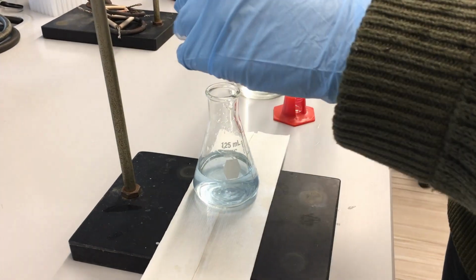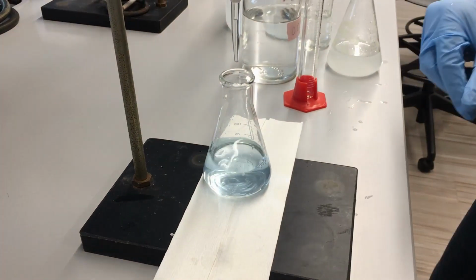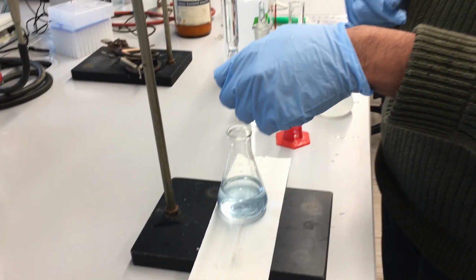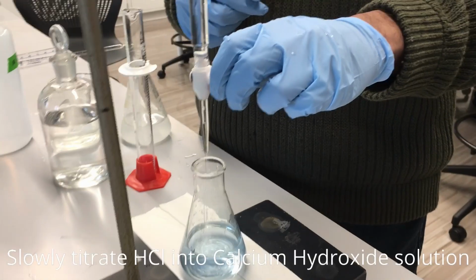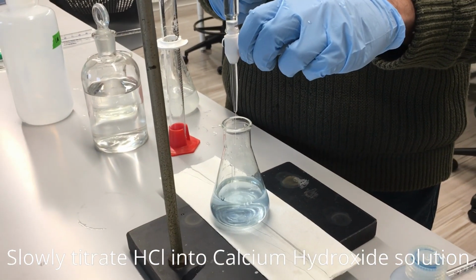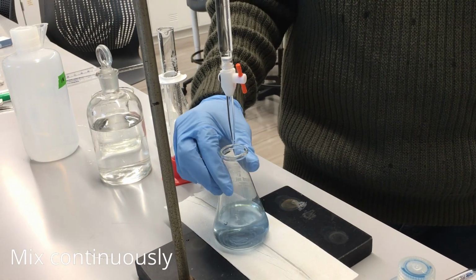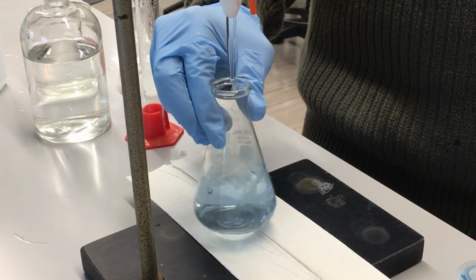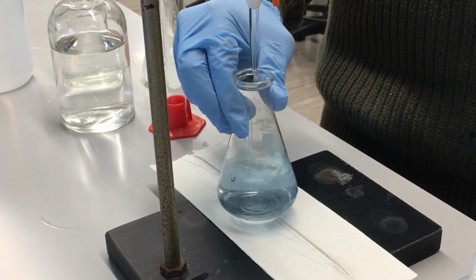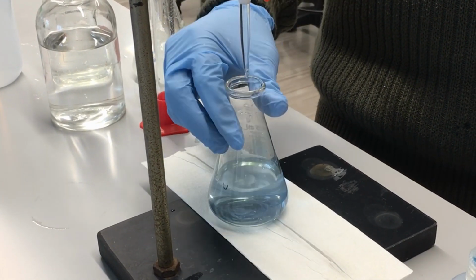All right, so now we will go ahead and start putting the titrant HCl into our calcium hydroxide, drop by drop. So we're going to start the titration. And once it reaches the equivalence point, which is of course when the moles of acid equal the moles of base, or the moles of HCl equal the moles of hydroxide, not calcium hydroxide, but hydroxide, then the solution will change color.